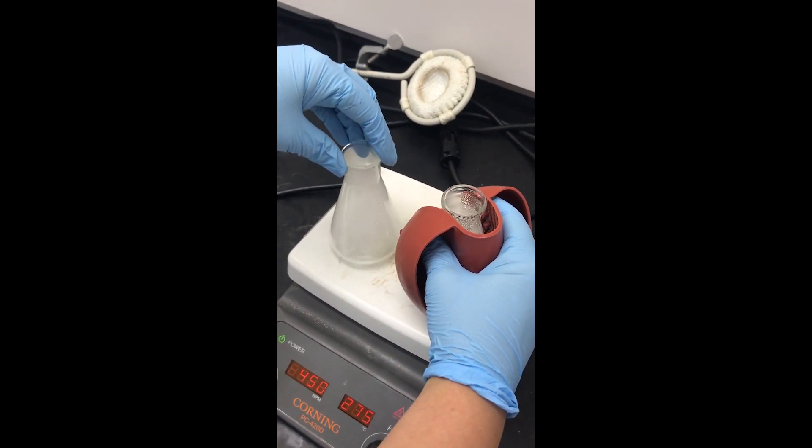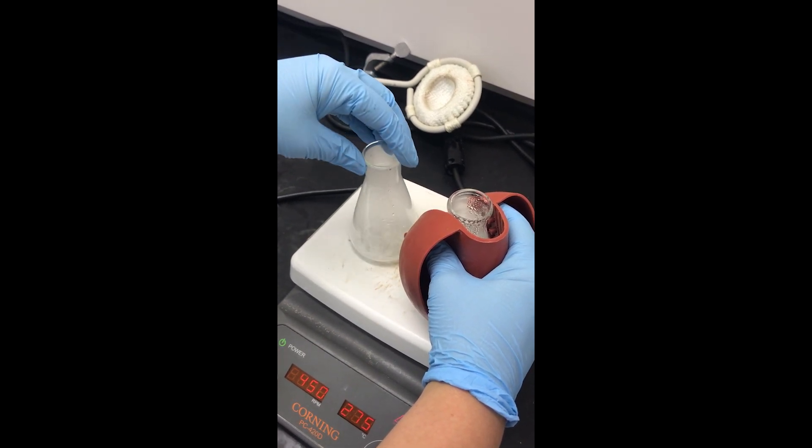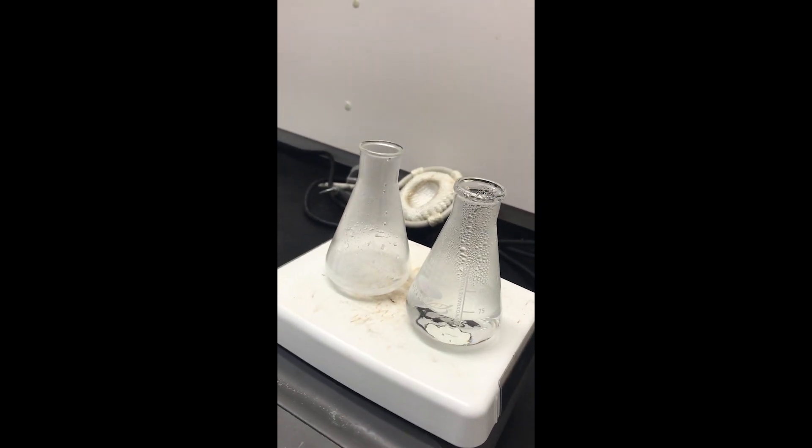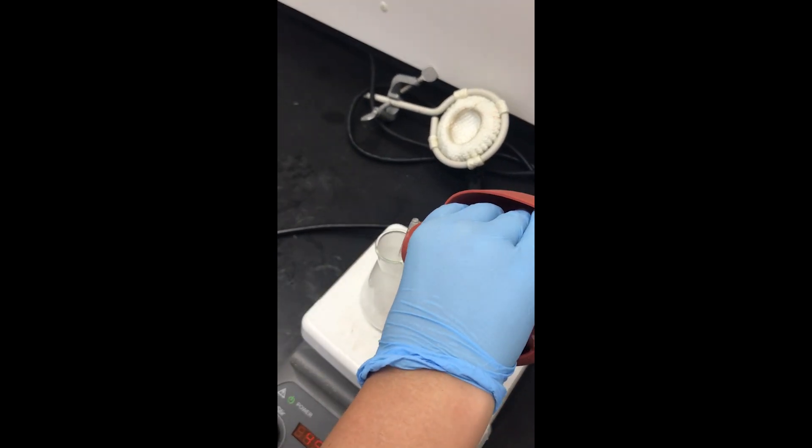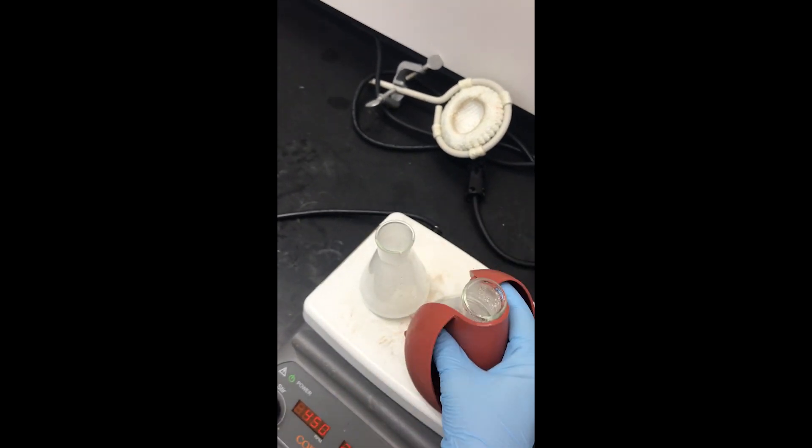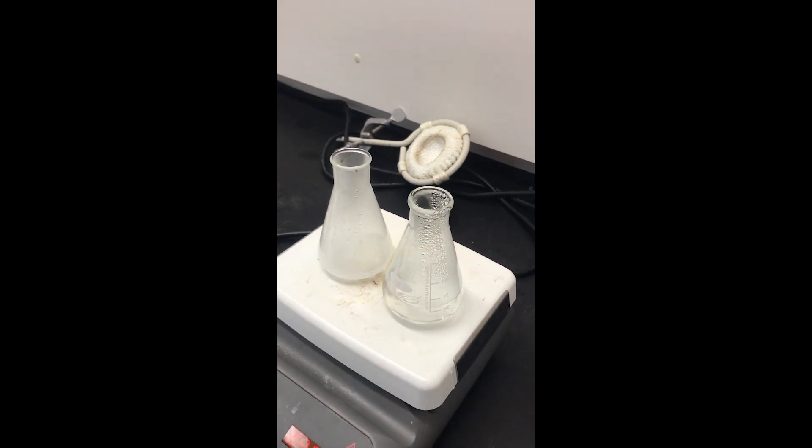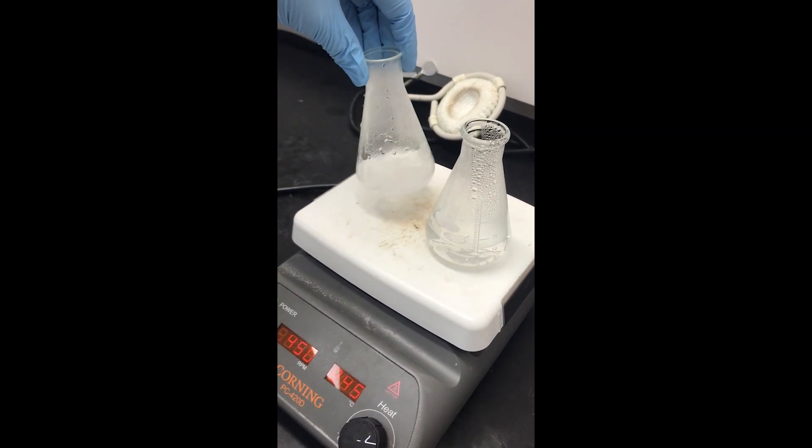It's a little hard to see because it's fogging up in there, but you can see that there's still quite a bit of solid. No point in waiting too long - we can just keep going. A little bit more. The water seems to be coming up. We can increase the temperature a little bit to make sure it stays nice and hot.